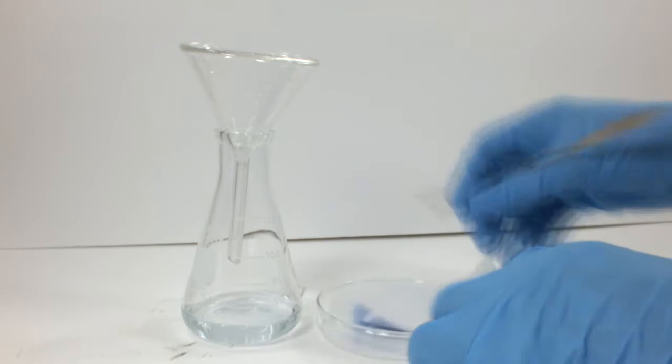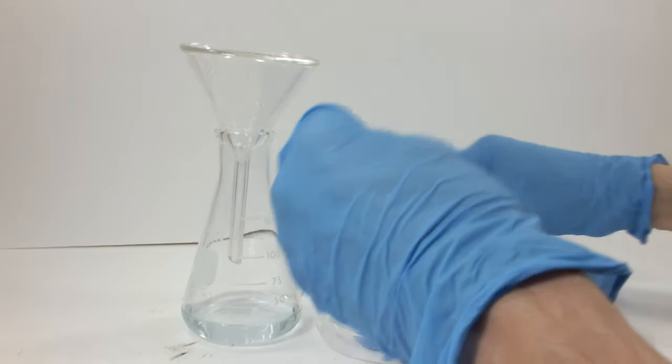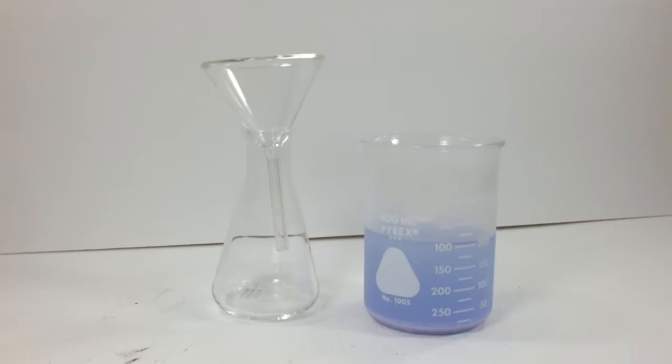Here's the mostly filtered sulfate complex, and you can see how wonderfully colorless the liquid phase is. I'm going to transfer the complex from the filter paper onto a glass dish to minimize loss of the product. Now we'll leave it to dry.